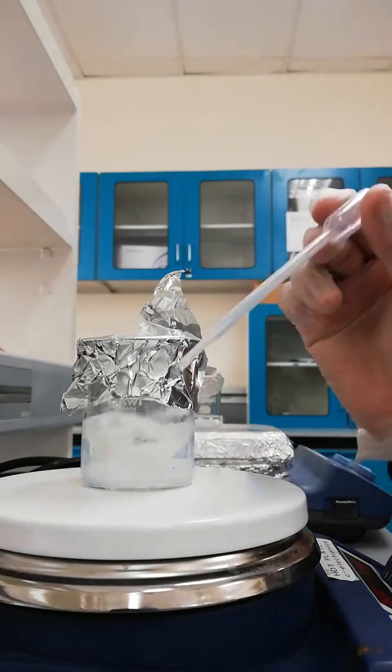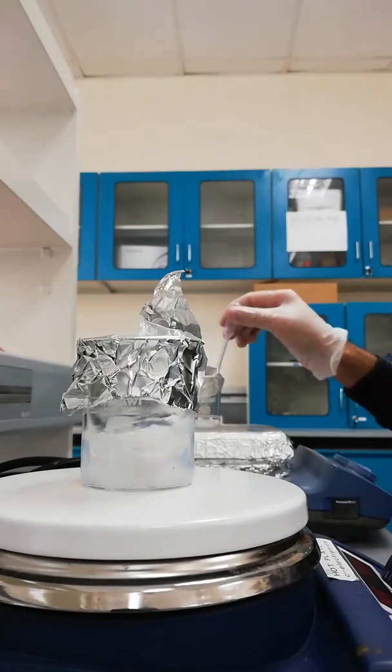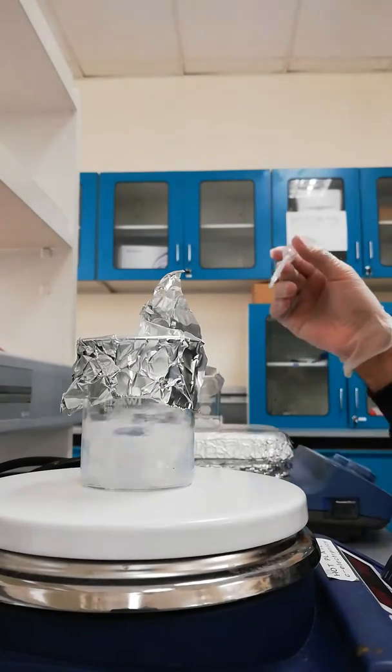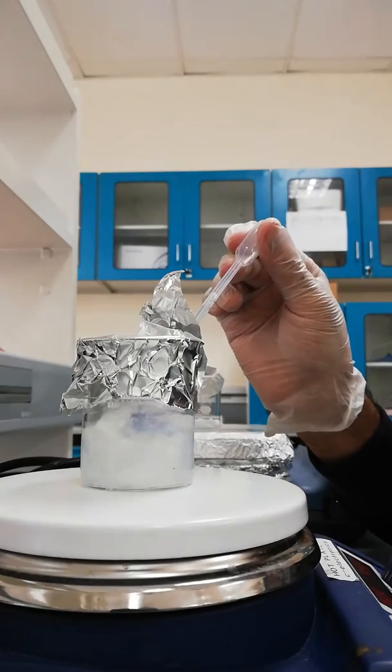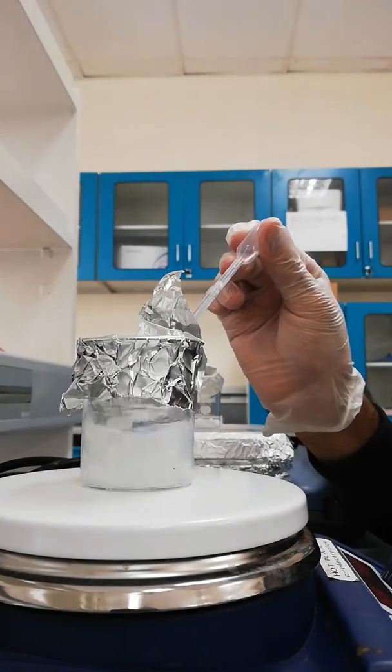Can you see it? Can you see the whitish one? It's turning into white.